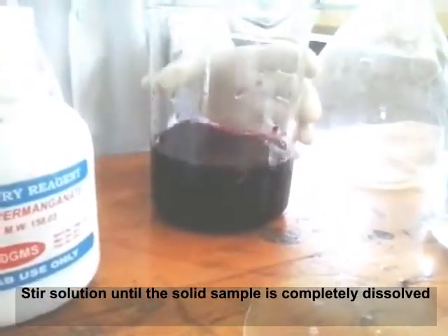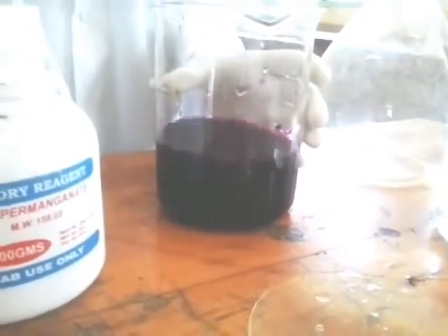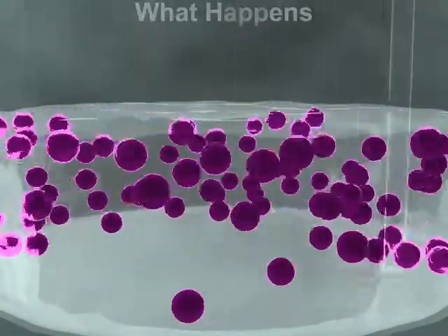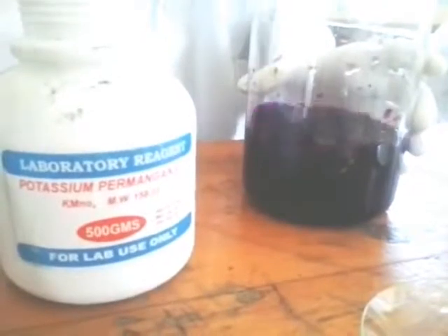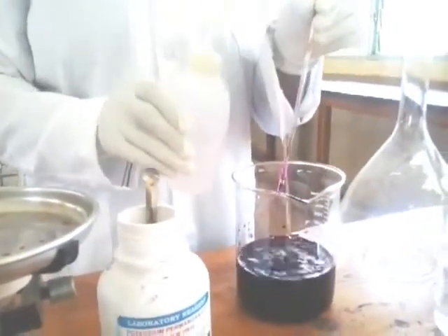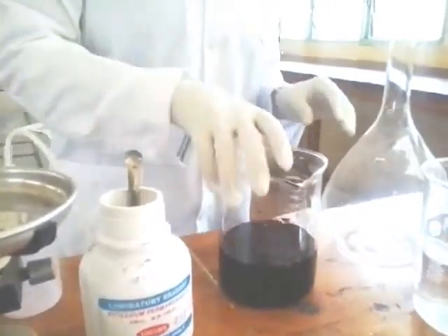After that, we stir the solution in order to make sure that the solid sample is completely dissolved. After dissolving, we rinse the glass rod using distilled water. After that, we transfer the solution into a volumetric flask.